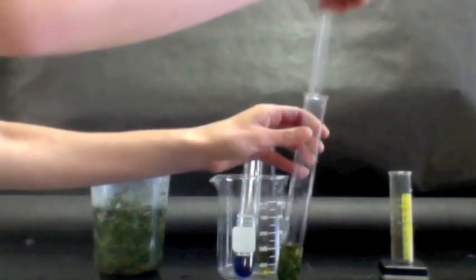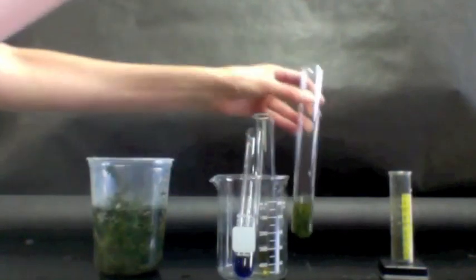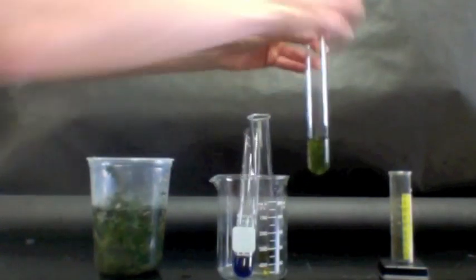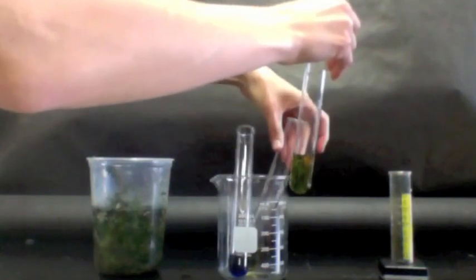Okay, so the color change that just happened, happened because of the carbon dioxide that's being dissolved into the water.